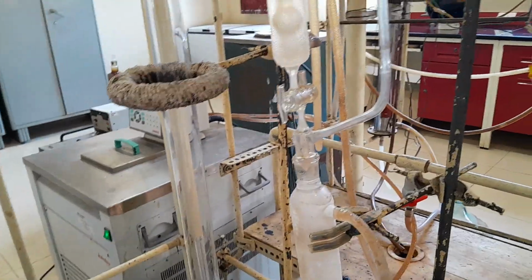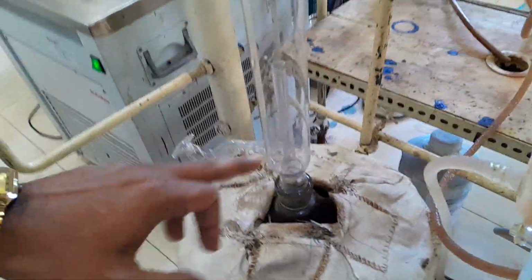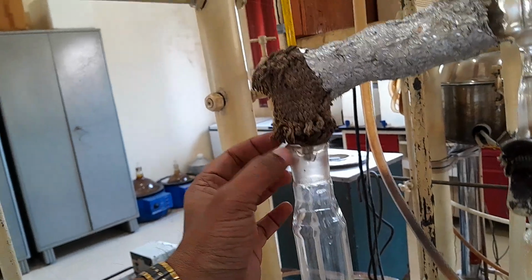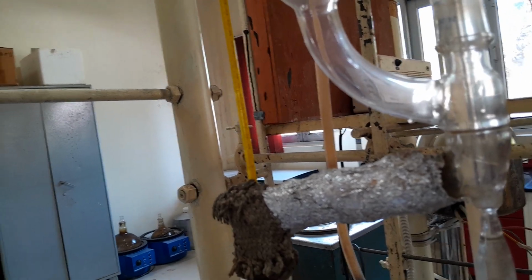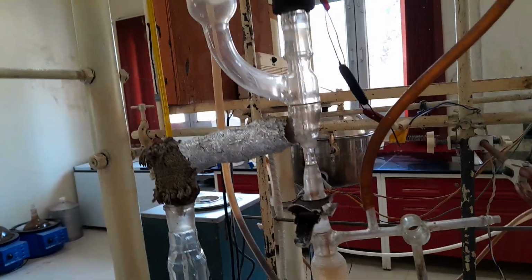So it will not vaporize again, because this is kind of locked off here. When you have the evaporation process and then the condensation process, it tends to flow on the wall. You will see the droplets condensed inside, on the wall, because that's where it cools.